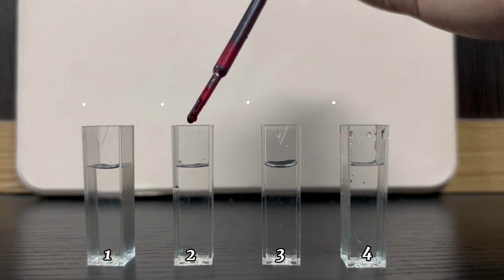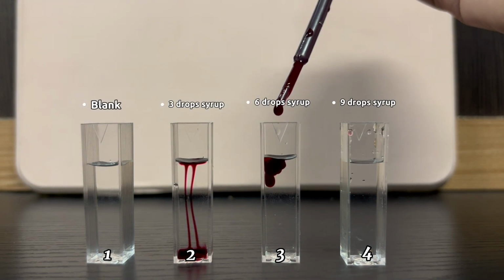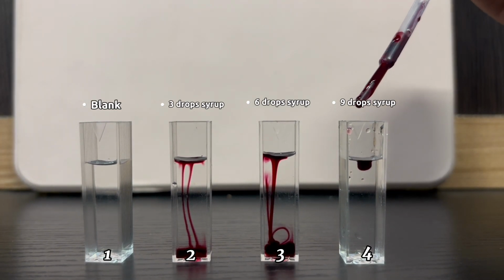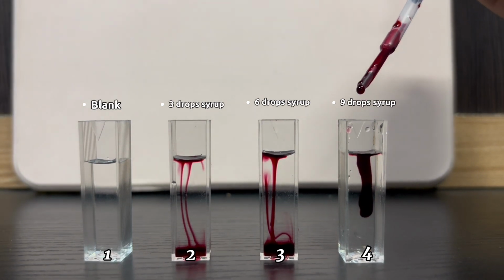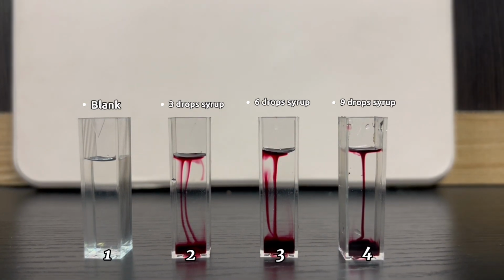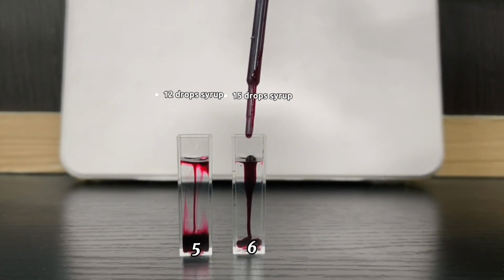We have prepared 1 blank and 5 sample solutions by adding different concentrations of rose syrup to the solvent, which is tap water, in separate cuvettes. The blank solution is in cuvette 1, while 3 drops of syrup are added to cuvette 2, 6 drops of syrup in cuvette 3, 9 drops in cuvette 4, 12 drops in cuvette 5, and 15 drops of syrup in cuvette 6.